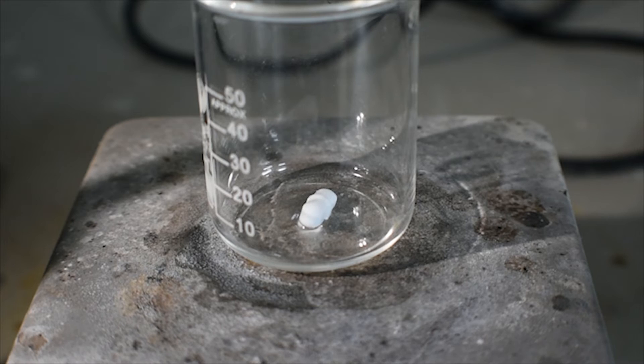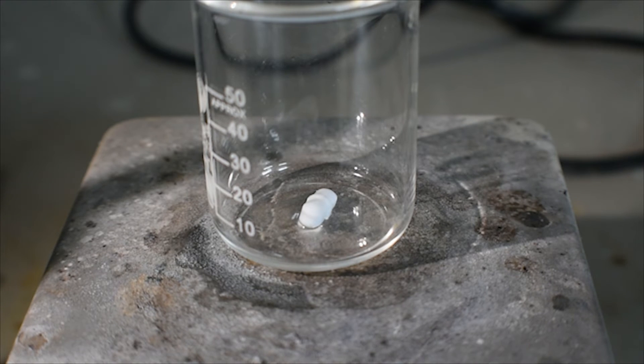So what I'm going to do from here is add the solution of potassium tetrachloroiodate in hydrochloric acid to the cesium chloride solution, which will precipitate cesium tetrachloroiodate as a yellow solid and will leave potassium chloride in solution, hopefully. So, here we go.